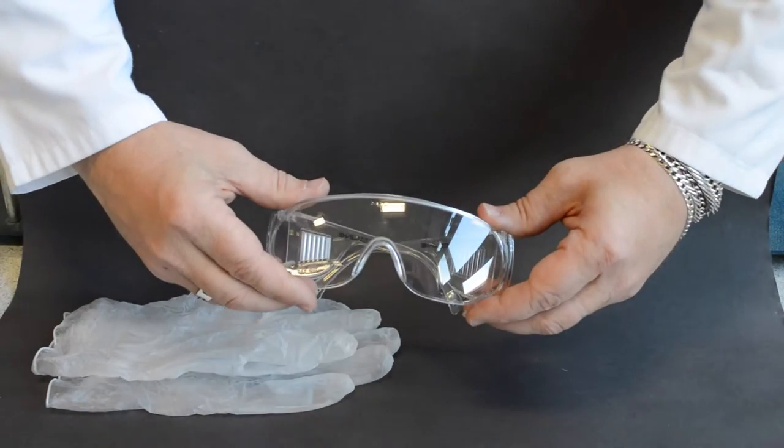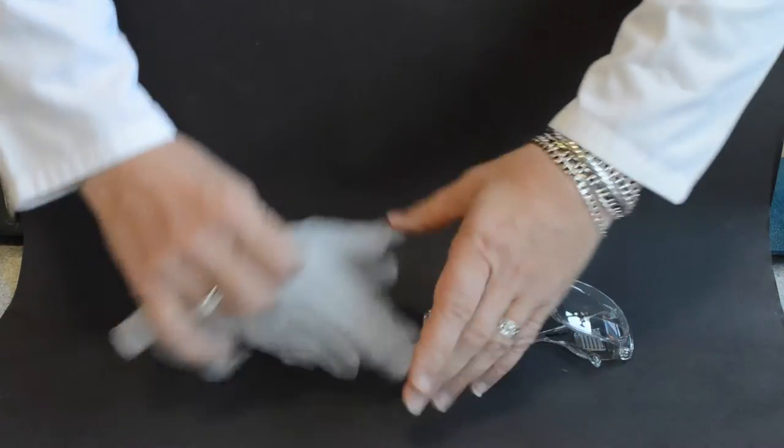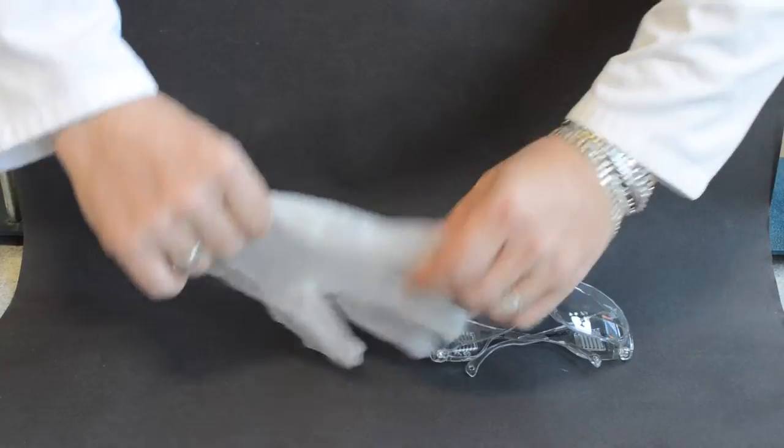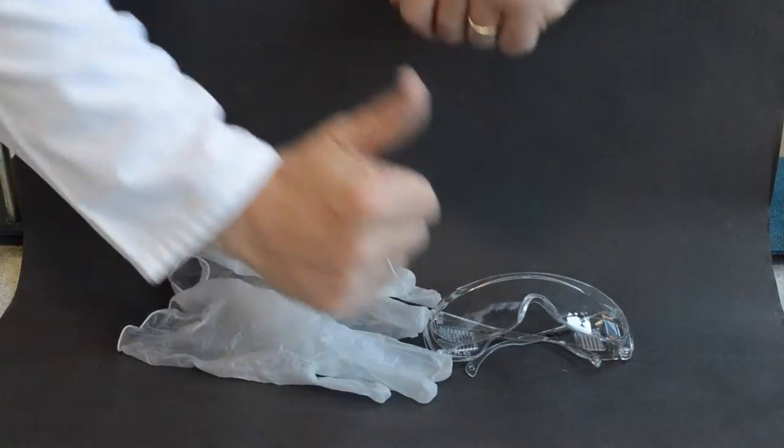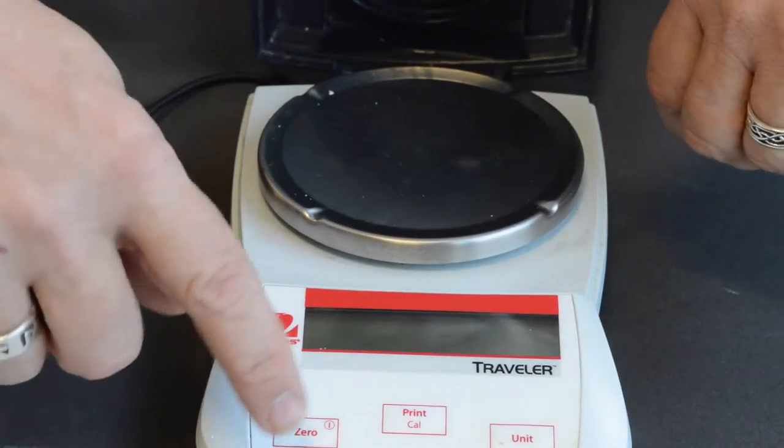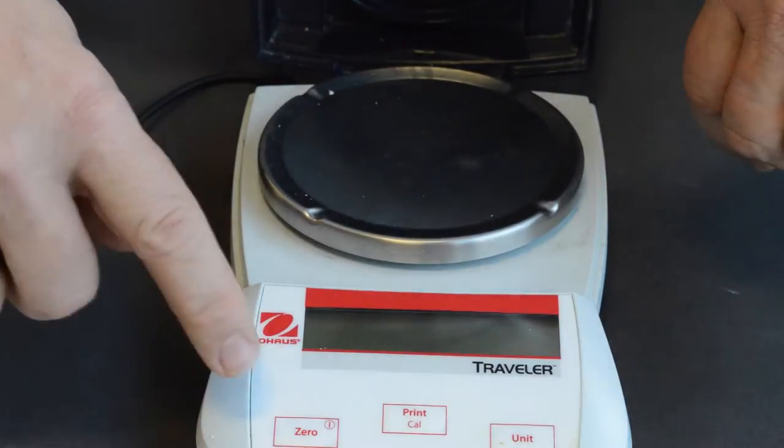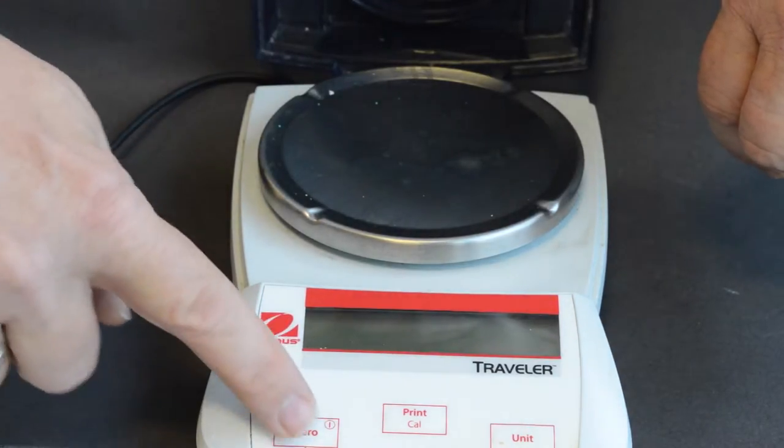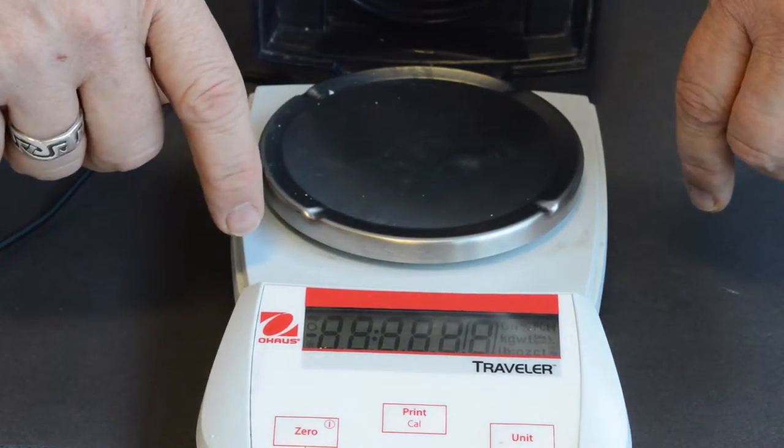Please use your personal protective equipment as directed by your tutor or as indicated by your worksheet. Using a top pan balance, ensure the balance is turned on at the mains, then press on which is also the zero button.